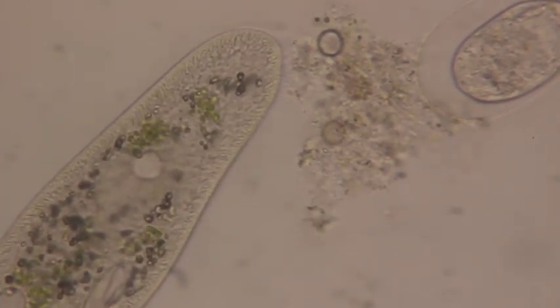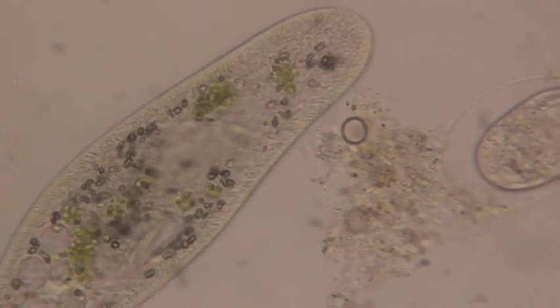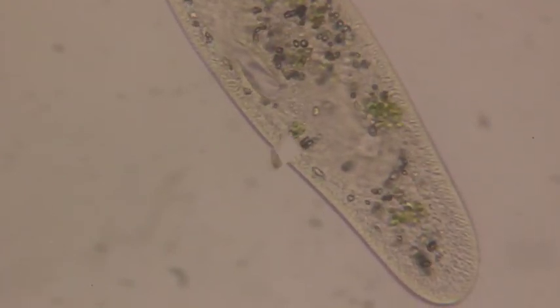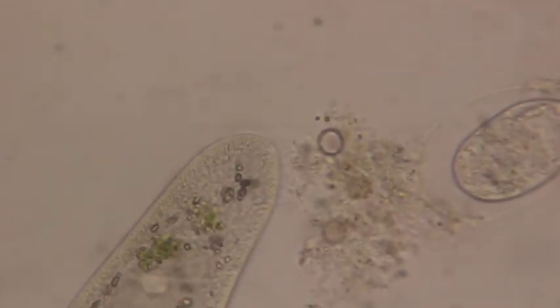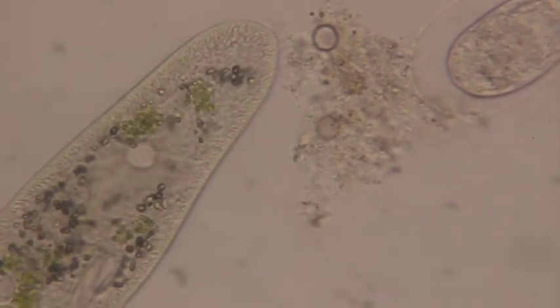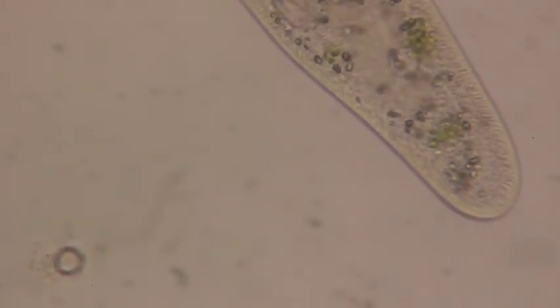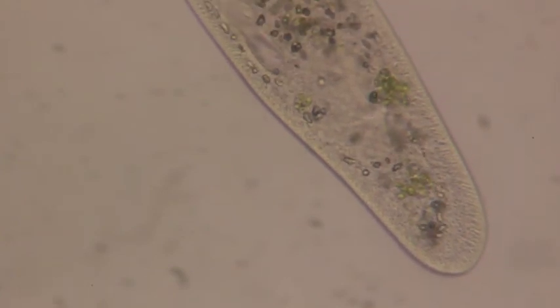The ciliate we're looking for in the culture is a paramecium. The key problem that paramecium have in fresh water is that water enters their cells through osmosis. It passively enters the cells, so paramecium have a structure called a contractile vacuole. You can see the contractile vacuoles fill and then empty and expel all that water outside. It's full — and now it releases. There goes another contractile vacuole filling up, then it releases and all of the water is pushed out.